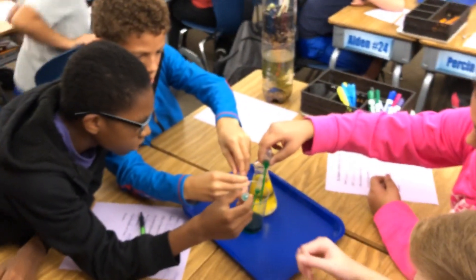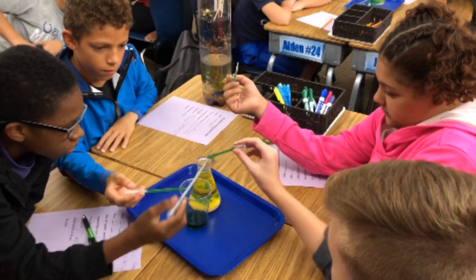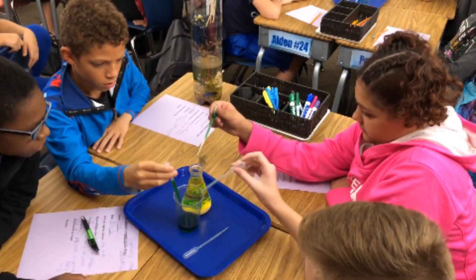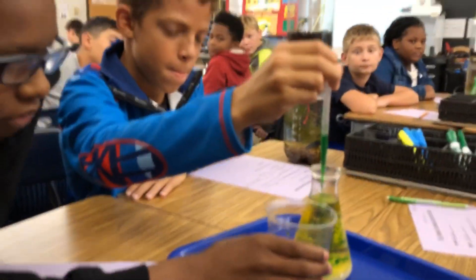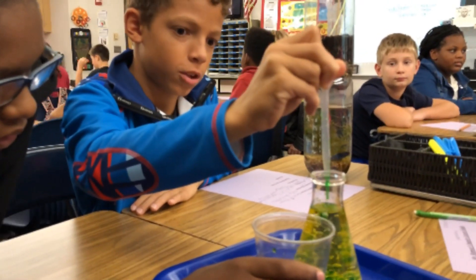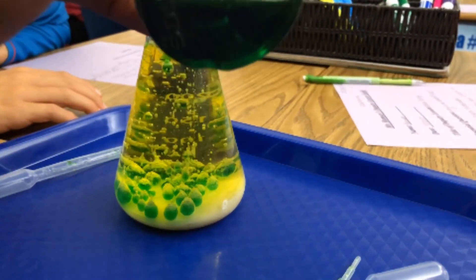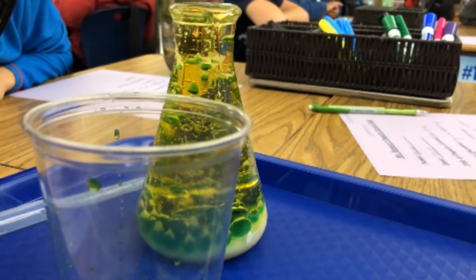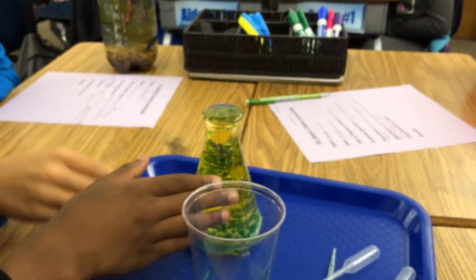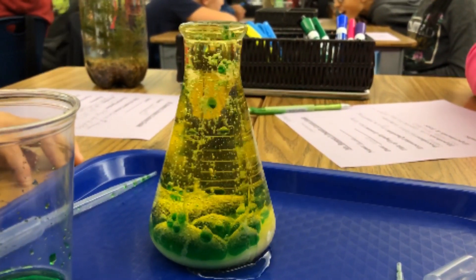Let's come over here to table five. Add your catalyst — I think you guys are going to have a green lava lamp. Alex, what is in the bubbles that you see rising — what kind of gas is being released? Carbon dioxide. Yeah, it's carbon dioxide. So this is sodium bicarbonate down here — NaHCO3 — and it's decomposing into carbonic acid, sodium acetate, and carbon dioxide gas. Now feel the flask — does it feel cool or hot? It's cold. So is it exothermic or endothermic? Endothermic — that's right. It's absorbing heat, not releasing heat. The bubbles aren't rising because of heat — they're rising because they're less dense than the oil.